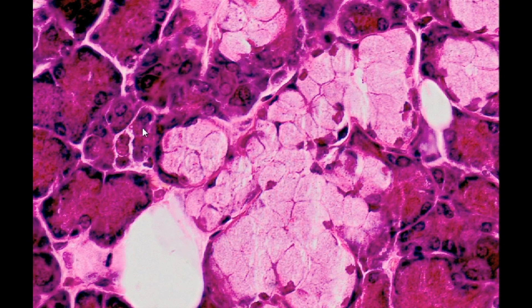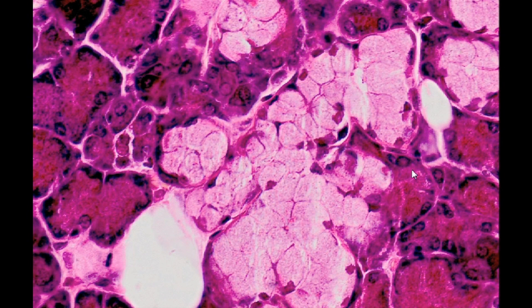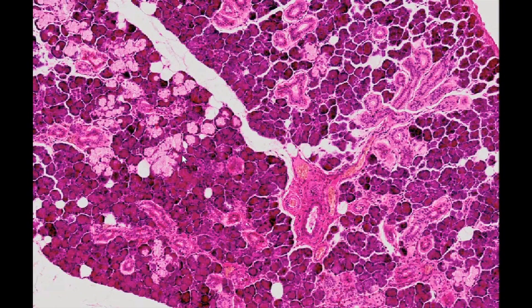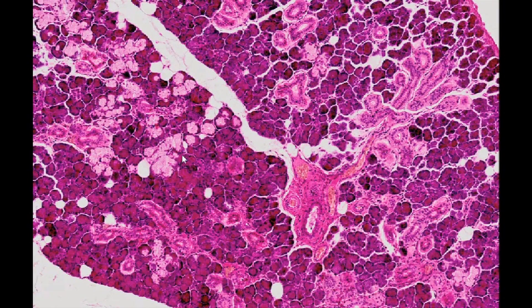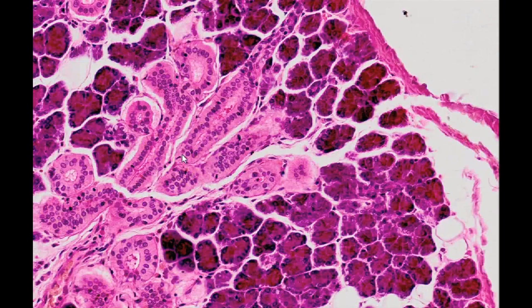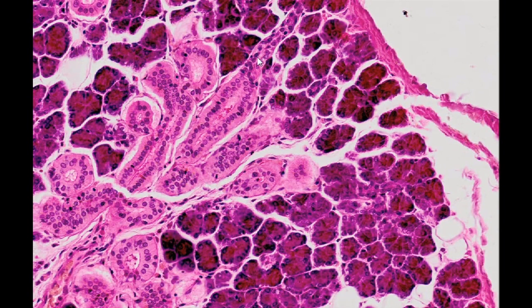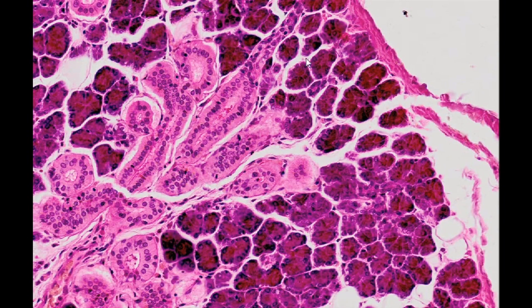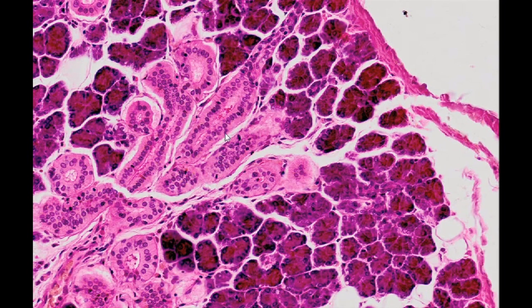Hence, the serous elements are stained dark purple. The secretory ducts of the salivary gland are divided into intra- and interlobular ducts. The intralobular ducts include intercalated and striated ducts.